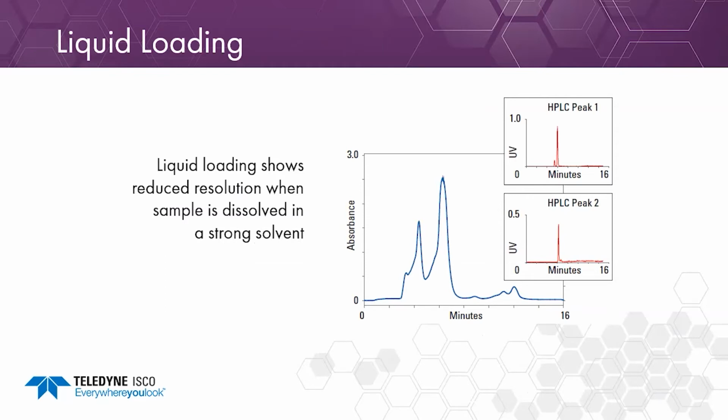And then finally for liquid loading, if I were to load this compound in a strong solvent here, you can see that we've got some peak fronting on that first peak. We don't get baseline resolution. There's really poor peak shape on the first and the second peak, and we're not getting a good separation of compounds, and basically a purification that we'd probably have to redo. But that's liquid loading with a strong solvent, so keep that in mind. If we had a weaker solvent, we could get better resolution if the sample was able to be dissolved in that weak solvent.